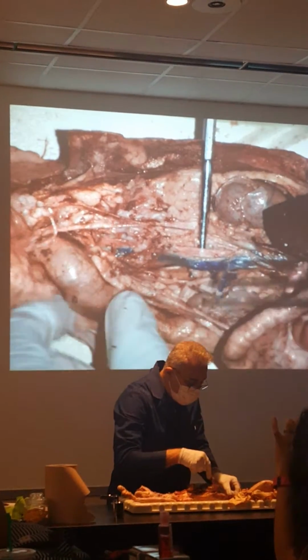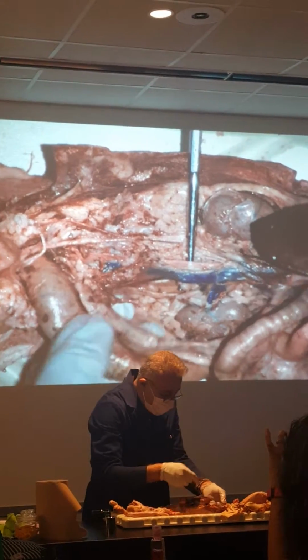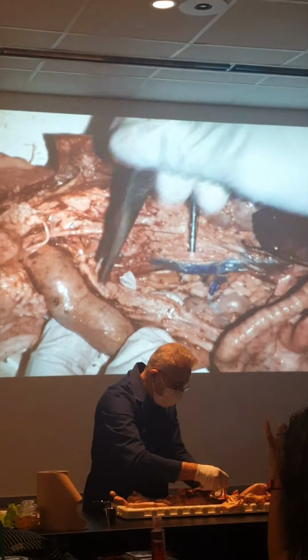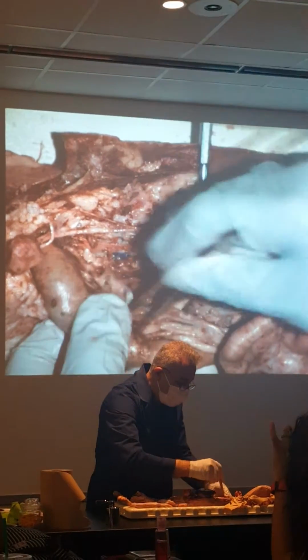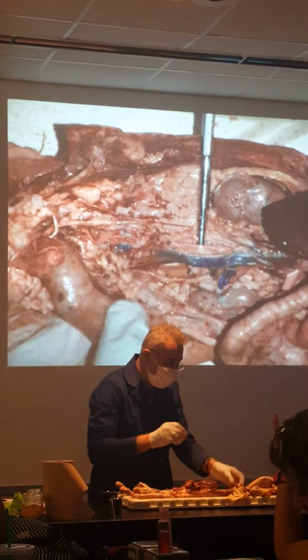This is a large intestine full of crap, right? There's a blood vessel that hit it, that cut it. This is inferior mesentery because it's connected to the inferior mesentery. Remember, this is inferior mesenteric artery? It hits it. This is inferior mesentery.